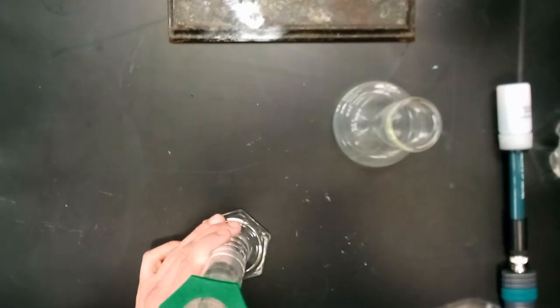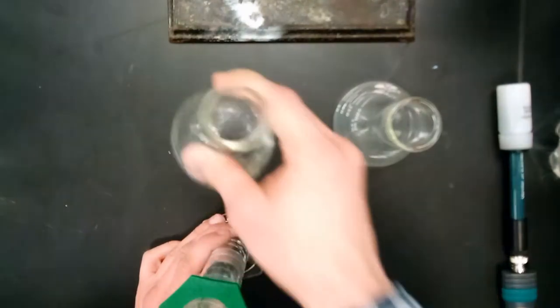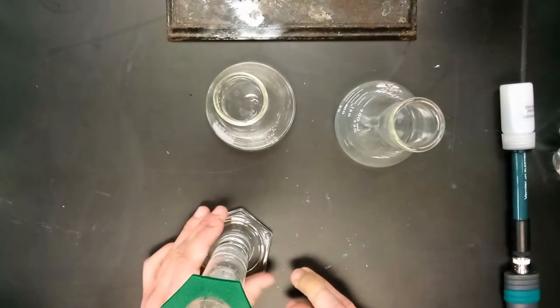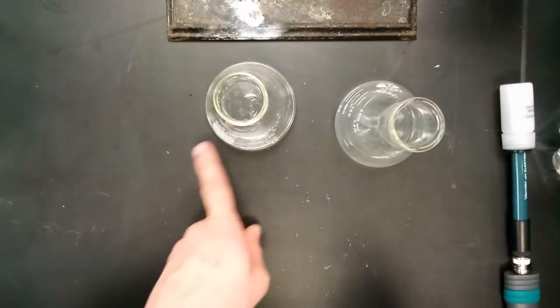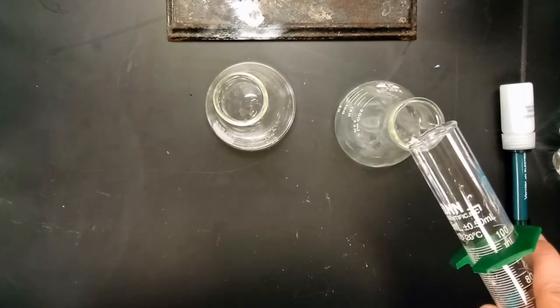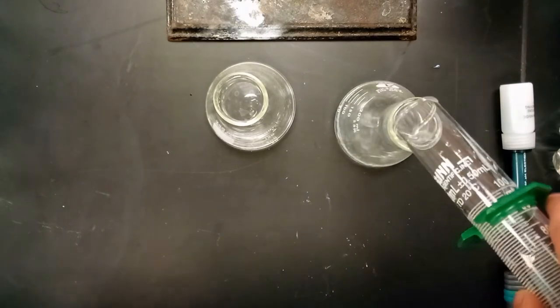You want to get as close to 50 as you need to. If you need to pour some back into the graduated cylinder, that's okay. So there's our 50 milliliters into there and our 50 milliliters into the other one as well.